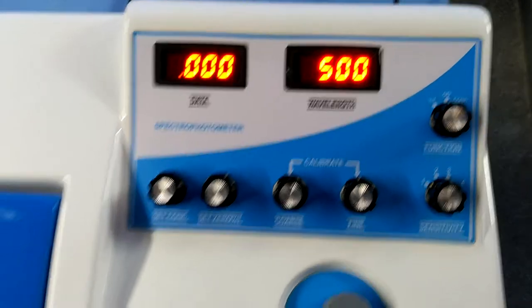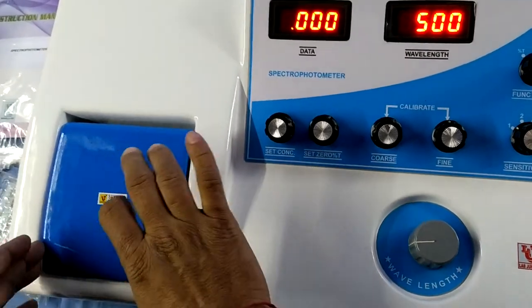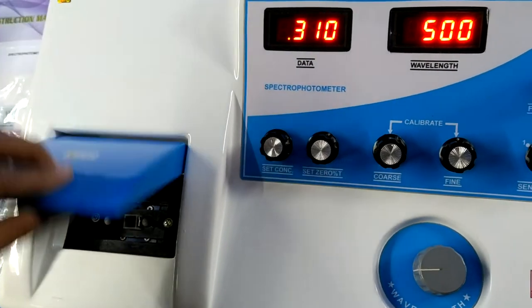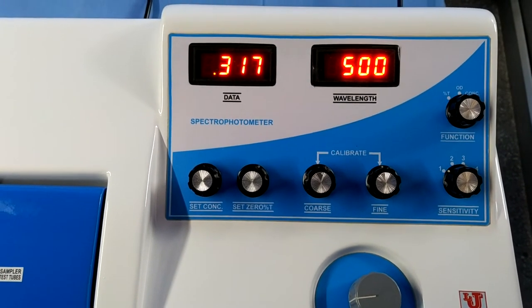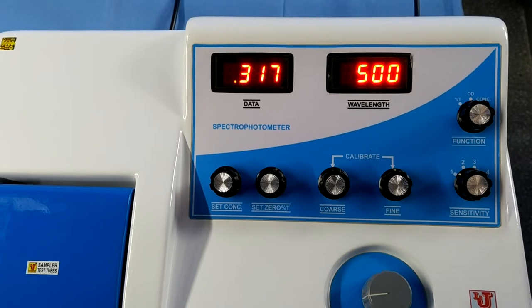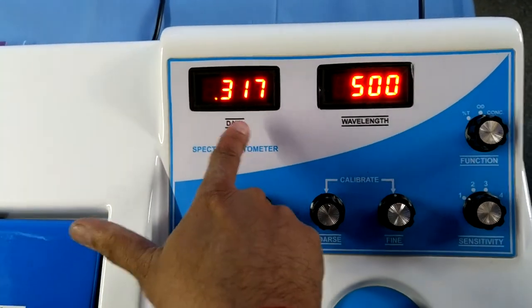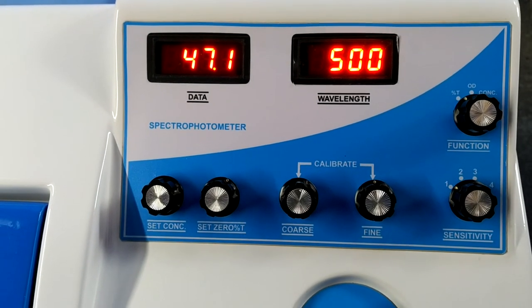Replace the blank with the sample solution and go to proper analysis. I am placing this sample like this. Now this is your final result on 500nm. If you change your wavelength to 550nm, the same process will repeat again. One parameter is pending — that is concentration. This is your final result of optical density absorbance, and this is your transmission of your chemical.